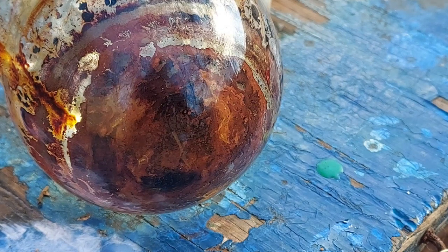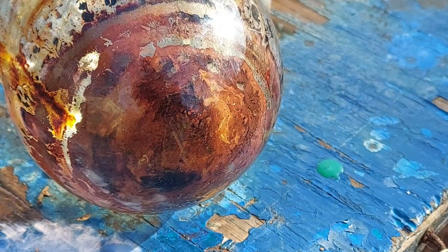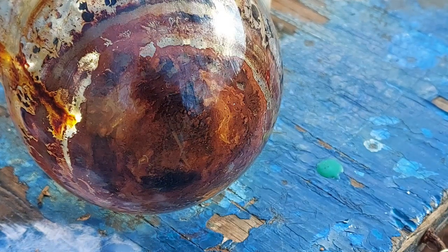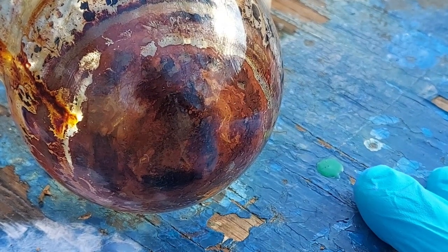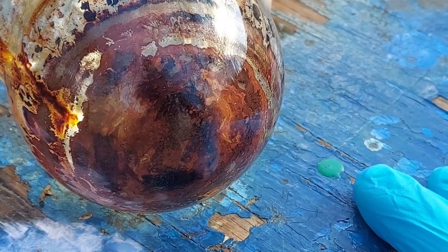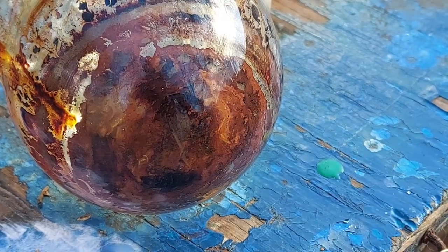I'm trying to figure out what the best way to proceed really is. There's no getting around having to expose it to the atmosphere at this point. I could either dissolve it in water and recrystallize it as the hexahydrate — which would prove even more than we've already proven that the method does indeed work, and that hydrate is just yellow, much like the other samarium halides — or I could try to break this up and keep pieces of it, and then eventually in the future, when I get a quartz tube, try making samarium diiodide by thermal decomposition. It'll be trapped in the quartz tube so all we'll be able to do is look at it and go 'woo!'